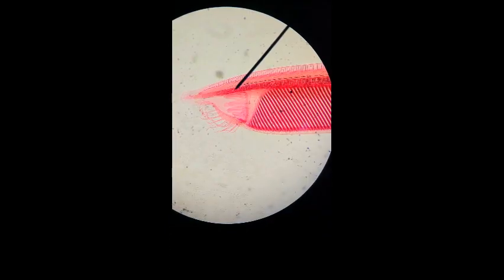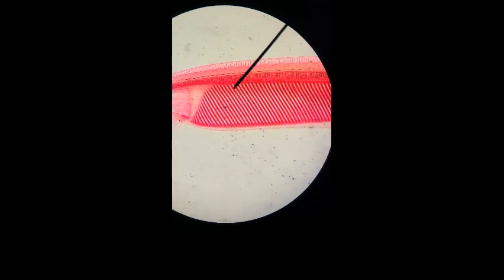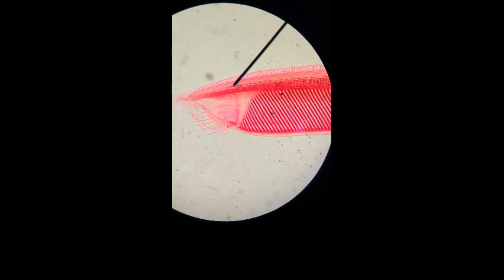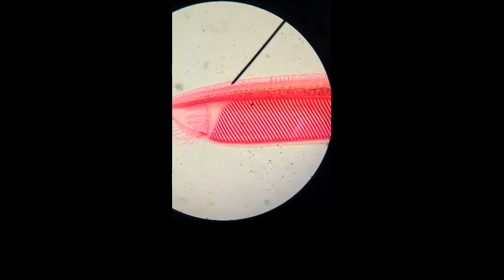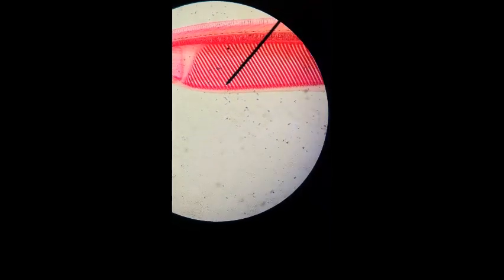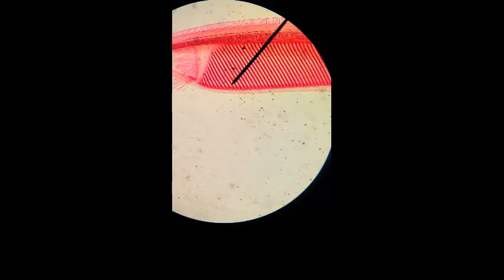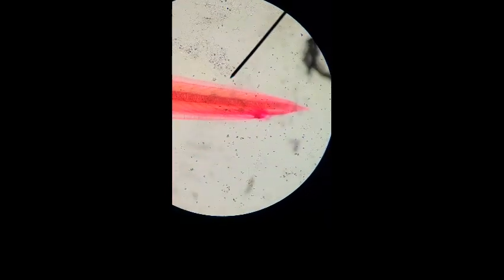This is our Amphioxus specimen. The first structure pointed out here is the notochord, which runs the length of the lancelet and is also located right underneath the dorsal hollow nerve cord, which also runs the length of the lancelet and can be observed right below the dorsal fin ray boxes. Here is our pharynx, which has the pharyngeal slits, and we have the endostyle, which are longitudinal ciliated grooves on the ventral wall. And then finally, we have our postanal tail, which extends past the gut region.